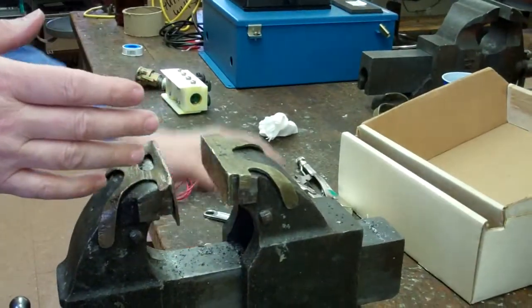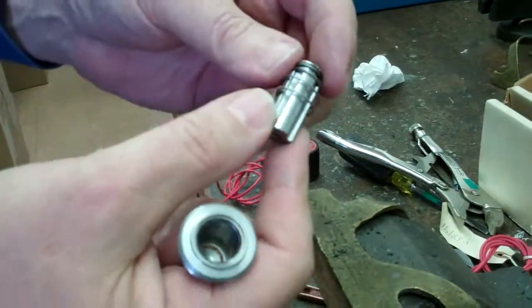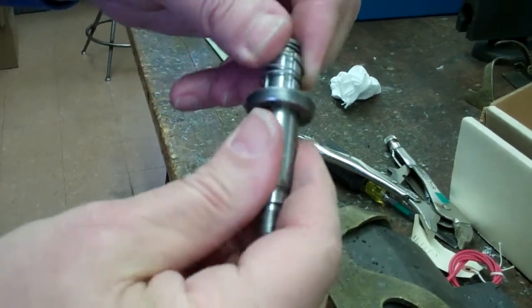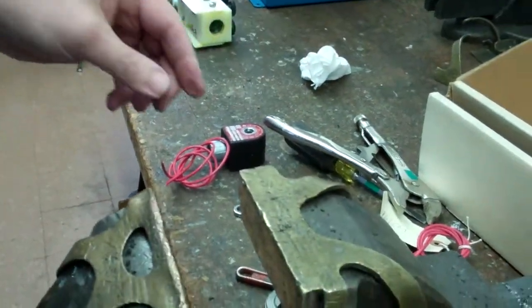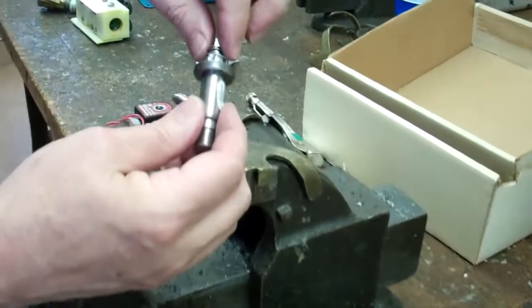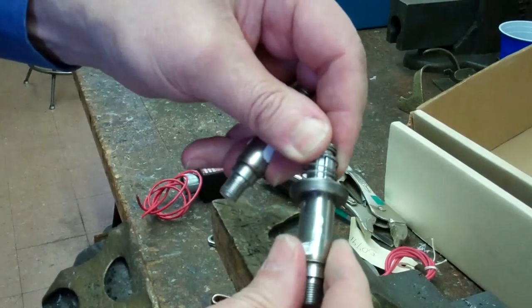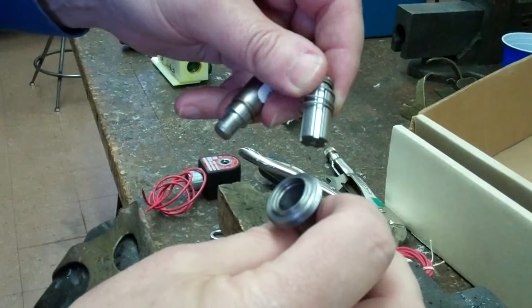So back to the original plunger. Now it's loose. See, it's not dropping in smoothly. It's going in hard. I can feel it hitting something. I'm going to put it down. I'm going to open up the other valve again. I can turn this. Easy. I take the return valve. Not easy. Something got in this valve.